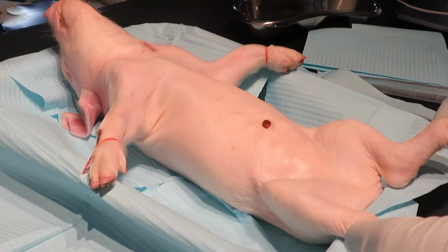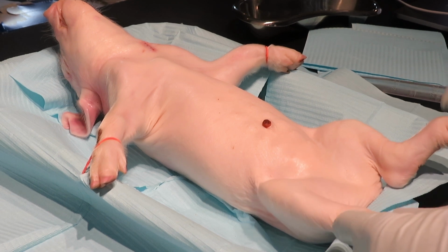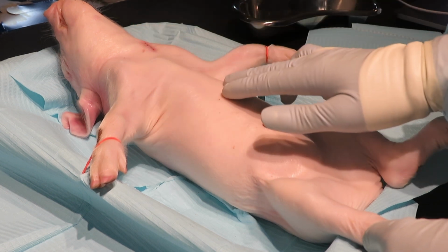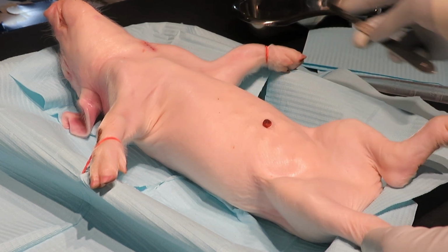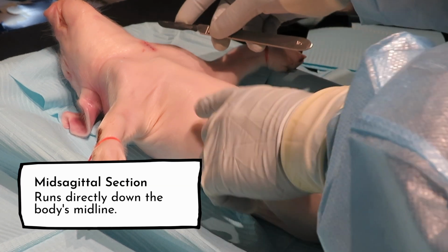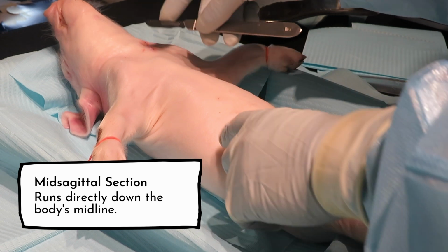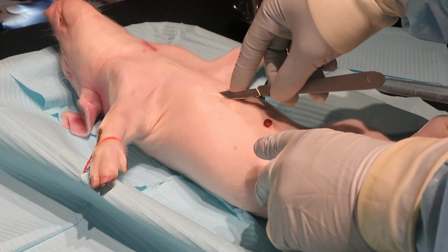Okay, I remember that before examining specific organs, we must start with the thoracic cavity before going to the abdominal cavity. We will now proceed and cut along the longitudinal plane using a mid-sagittal section from the superior portion of the sternal region down to the inferior most of the abdominal region.